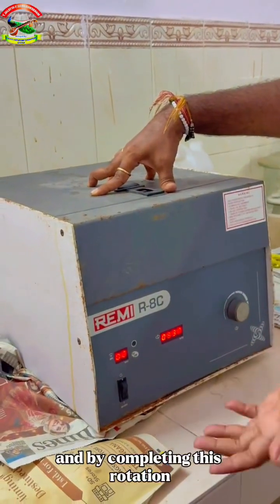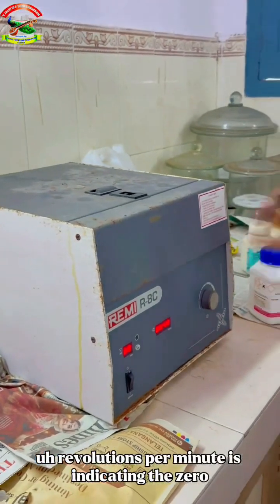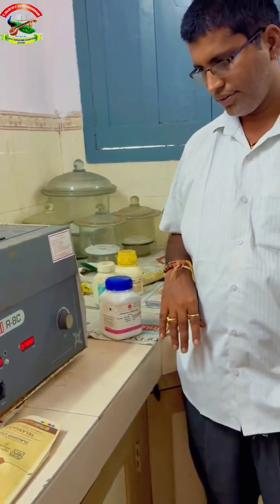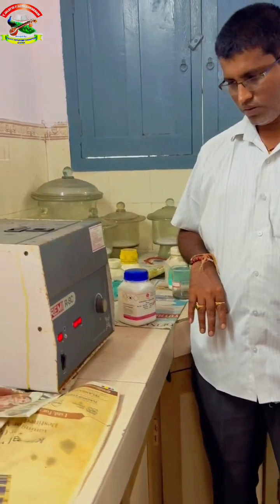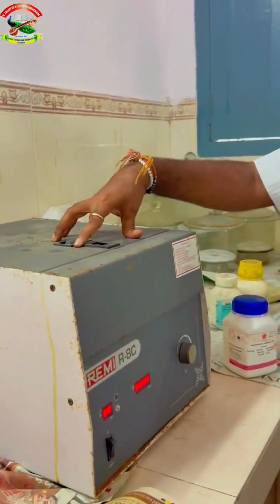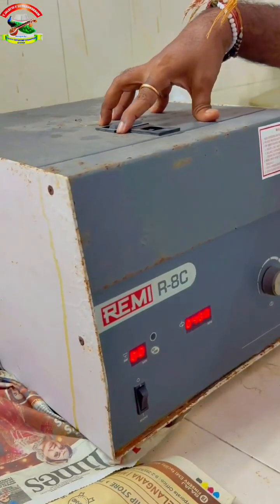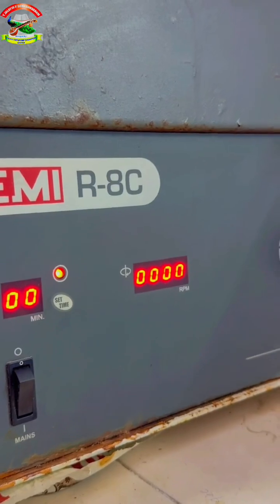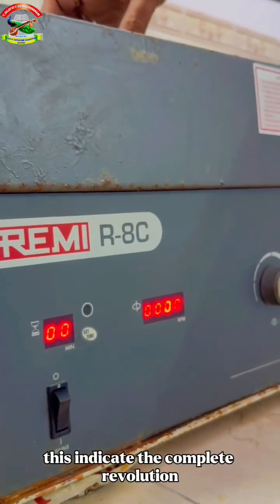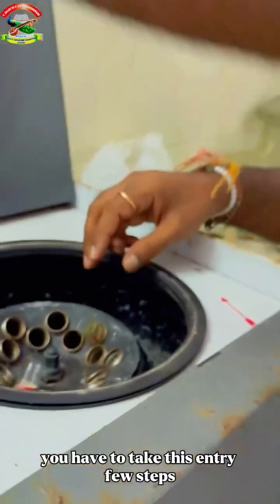By completing this rotation, revolutions per minute is indicating 0. This indicates the complete revolution, and by completing this process, you have to take out the centrifuge tubes.